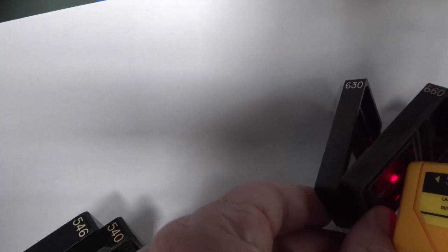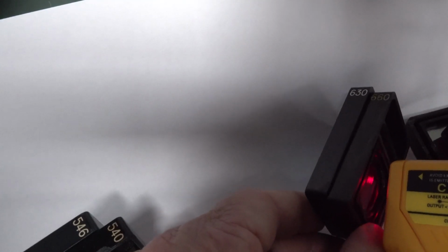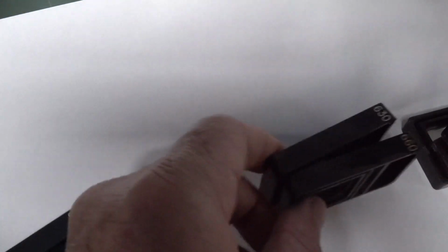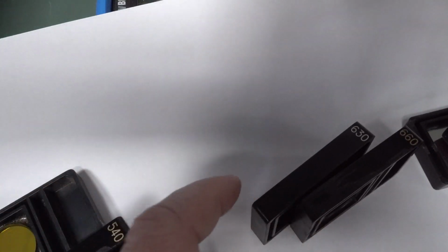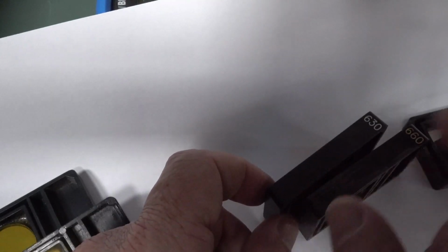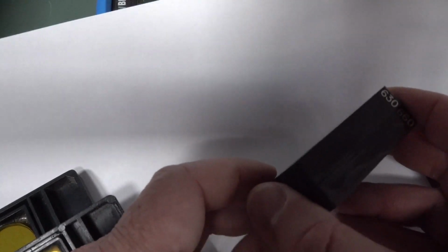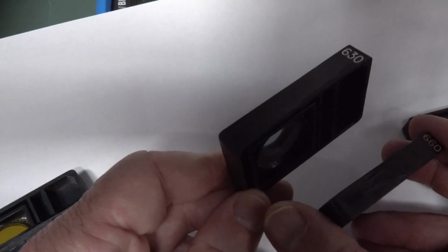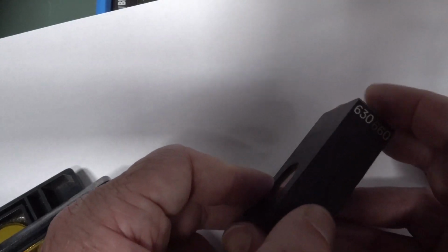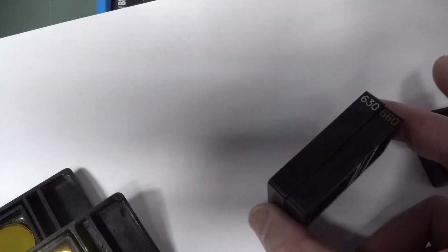I think maybe somebody wanted to see a laser. Let me get it. It'll only get through the 660. There it is. Gets through the 660. It just gets through the 630, but it won't get through both of them. I don't think that's an attenuation thing. I think it's just all out of bandwidth. If you turned your lights off and turned it right down and measured it, probably a little smidgen sneaks through.